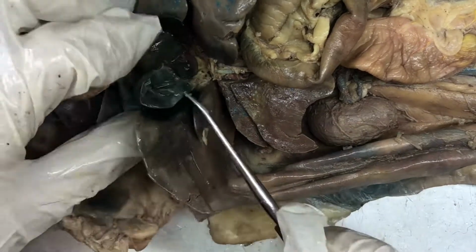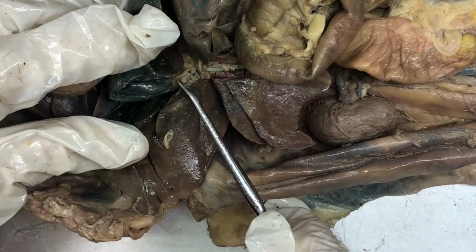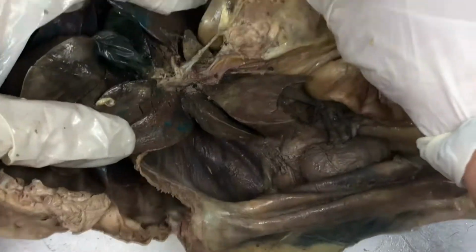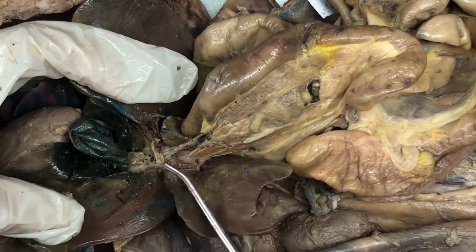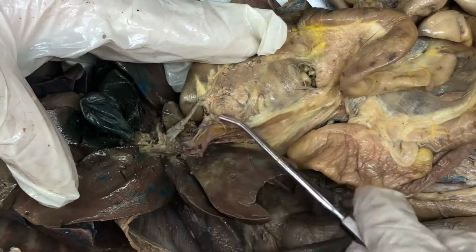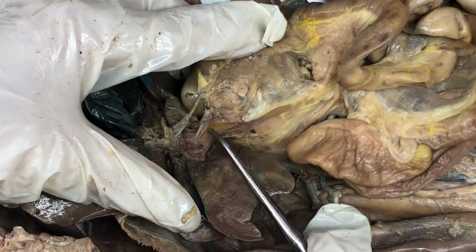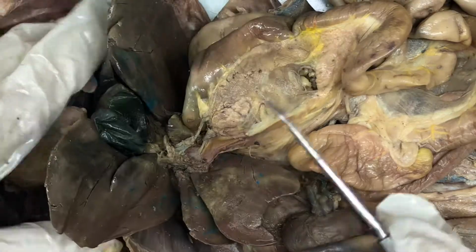From the gallbladder, we have the cystic duct, which is at the base of the gallbladder and runs into the common bile duct. So to see the common bile duct, we're going to kind of push everything this way. So again, the cystic duct is at the base of the gallbladder and it runs into the common bile duct, which is right here. And then we also have the hepatic portal vein, which is right here. It's kind of still a little bit red, but you can see that yellow. And typically they're stained yellow in preserved cat. So that's the hepatic portal vein.